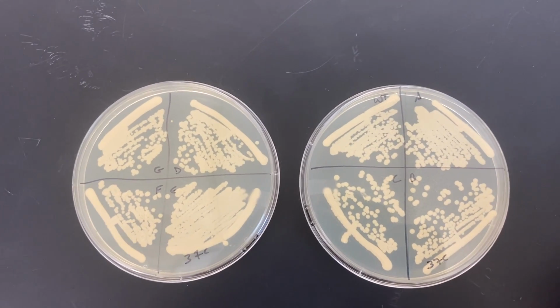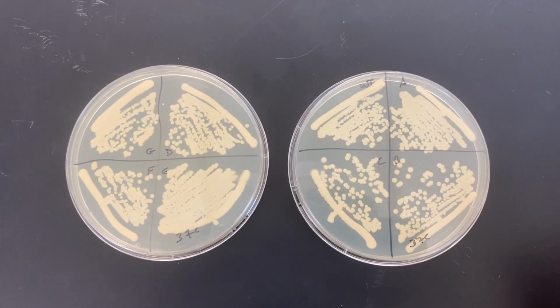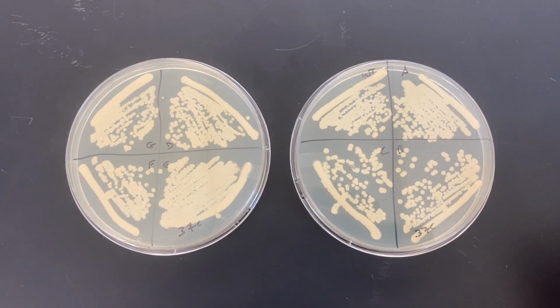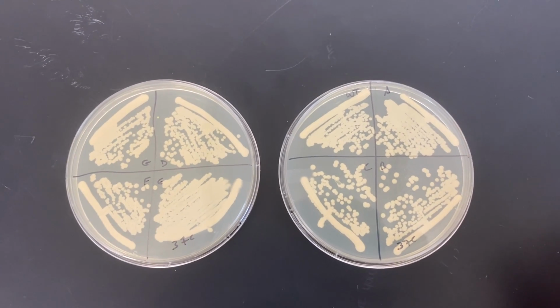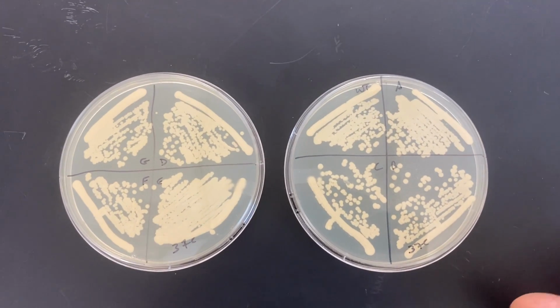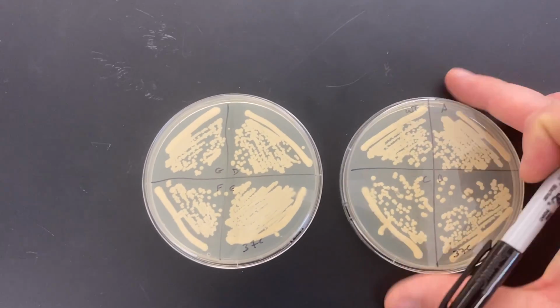Ideally, if we had total temperature sensitivity, this would be a condition that would prevent the cells from growing really at all, or certainly make a marked difference in how they grow compared to the wild type. Don't really see that here. What I think I see is really just differences in density. The cells that are growing closer together grow into smaller colonies, and the cells that grow farther apart, more isolated, can grow into bigger colonies. So I'd say maybe nothing really remarkable to report there.